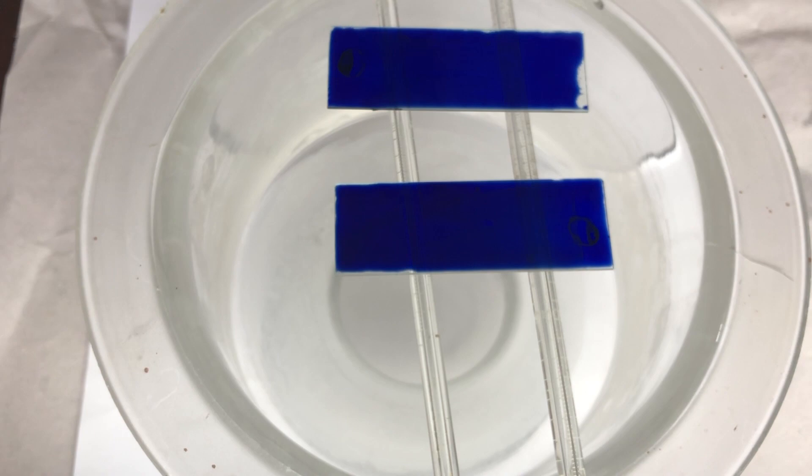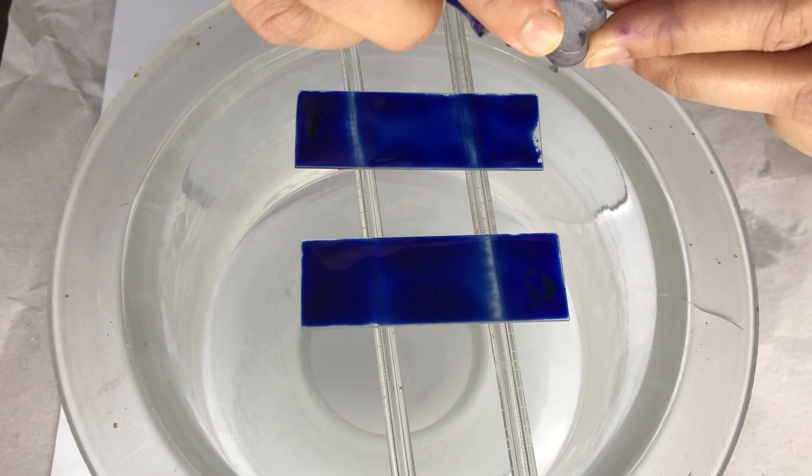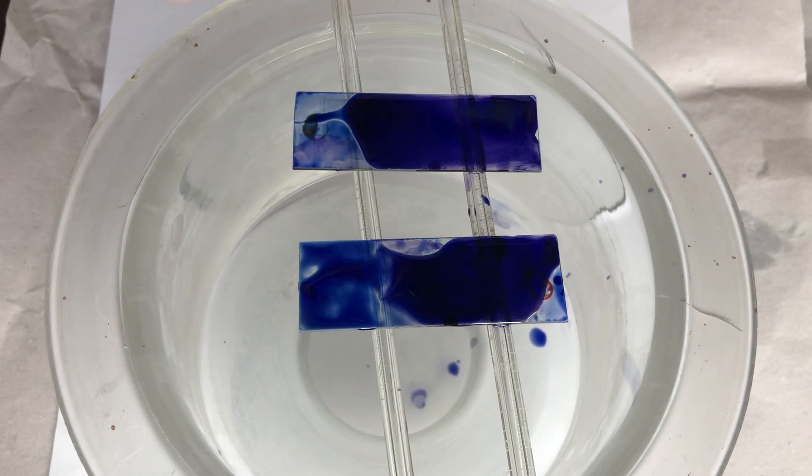We let the stain remain for about 2 minutes. Now the time varies as per the temperature of the weather. After 2 minutes, we pour buffer solution on this and then let it remain for about 8 minutes.